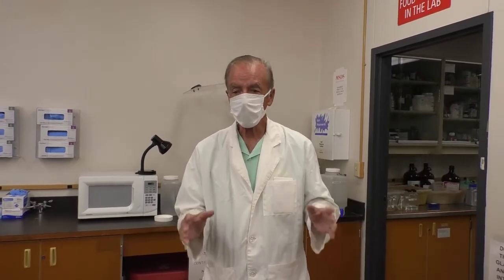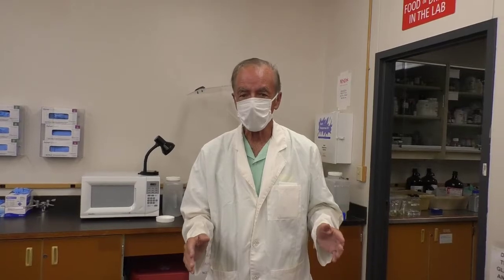And it will be important in your own home. You'll have to be careful about the plates that you incubate so that different people don't have access to your incubating plates. So always keep that in mind. Make sure you incubate your plates in a safe location.